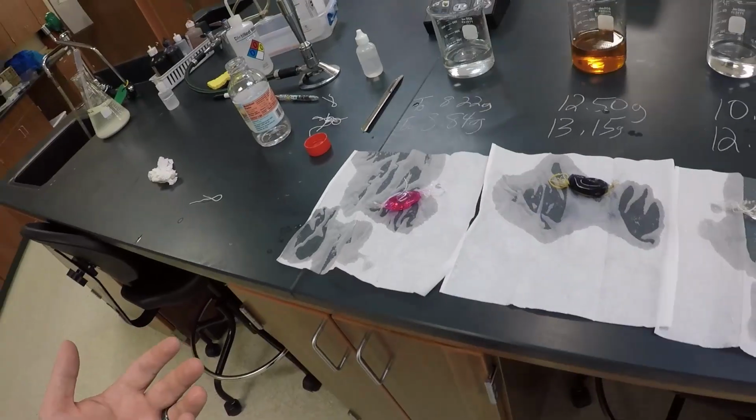So based on these results, you should be able to answer the questions on what properties you would expect for movement across a cell membrane, at least these cell membranes, and what color changes you expected, and what happened in the 4 different plasma membranes or semi-permeable membranes. Okay? With that, you should be able to complete the lab.